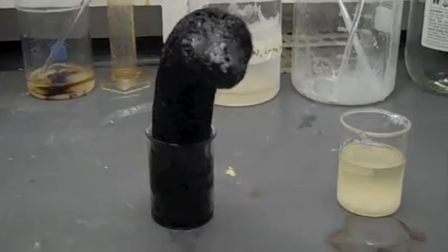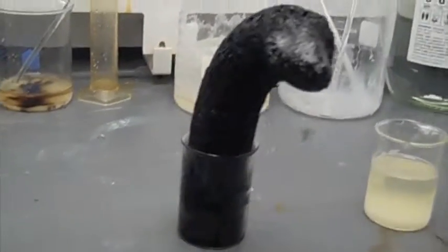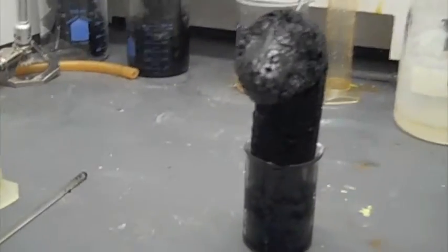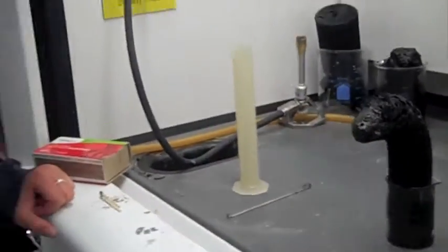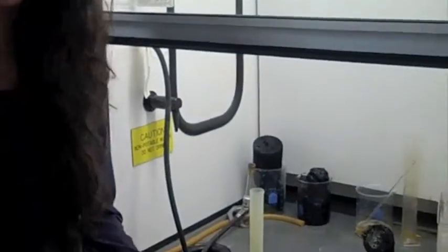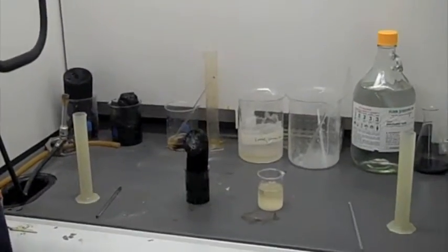In this beaker, with the concentrated sulfuric acid and sugar, a chemical reaction occurred. This means that it now has entirely new properties, unlike the concentrated sulfuric acid properties and the sugar properties. The reaction created SO2 and water vapor, which makes the charcoal mass expand and grow, and the water vapor creates the smoky gas that occurs. Here we've shown the difference between a physical and a chemical reaction.